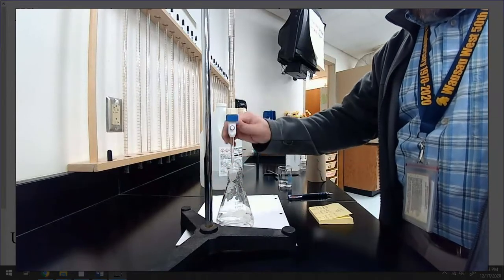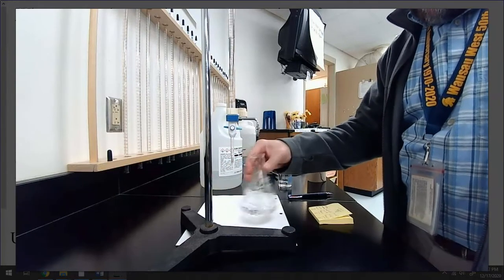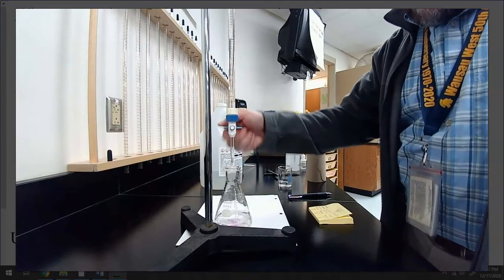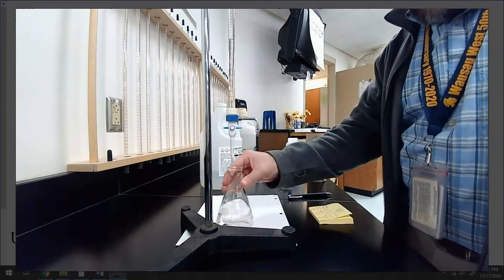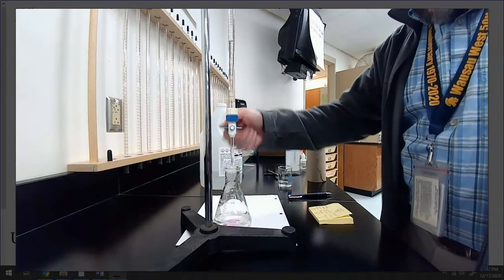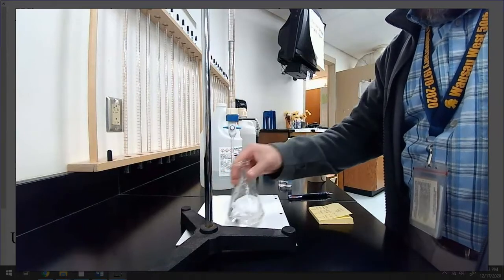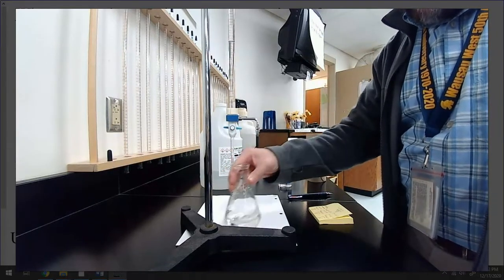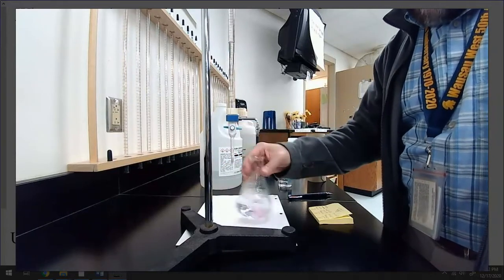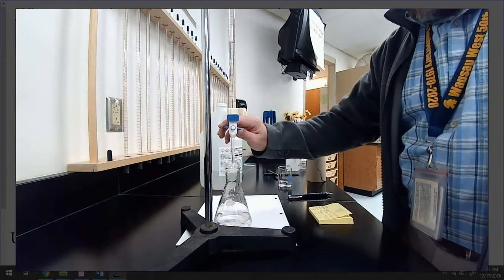Gotta be a little careful now. Getting close. Maybe not that close. And you'll notice that I do these slow half turns and these faster half turns. I do a slower one when I know I'm not right on top of the end point, and I'll do those quick ones when I know I'm getting super close. So that's just a technique. Again, I'd like to have you try it, but not the world we live in, unfortunately, at the moment.